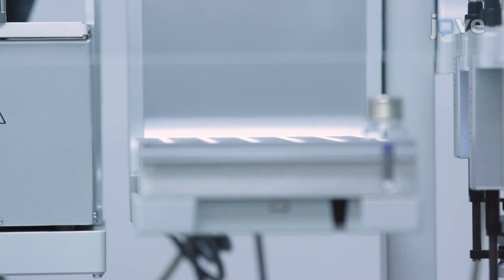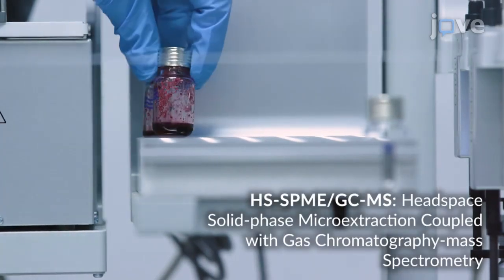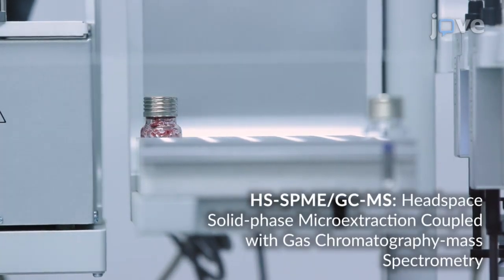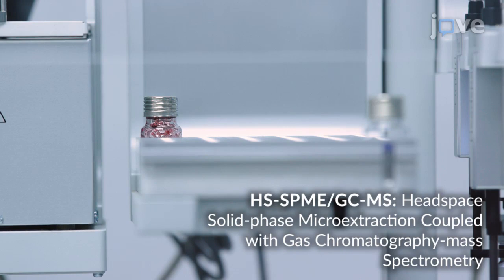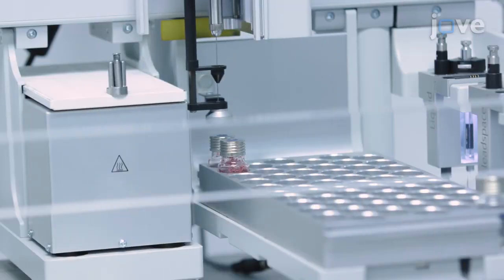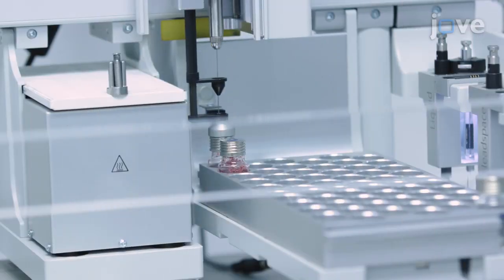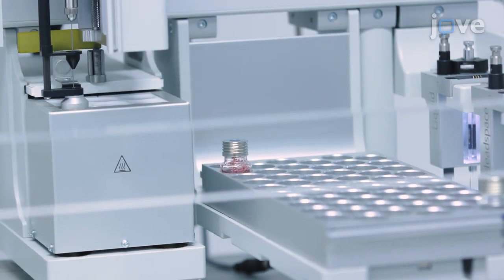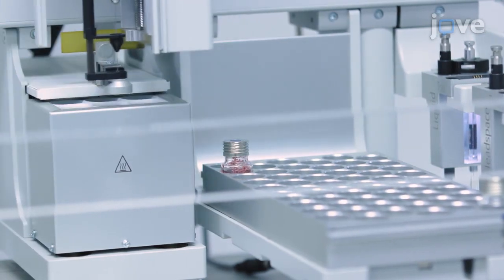Place the closed headspace vial in a GC-MS autosampler at room temperature for an automated HS-SPME GC-MS run, making sure the biological replicates are not placed in successive positions in the autosampler. Pre-incubate the headspace vials for 10 minutes at 50 degrees Celsius with agitation at 17 times G.